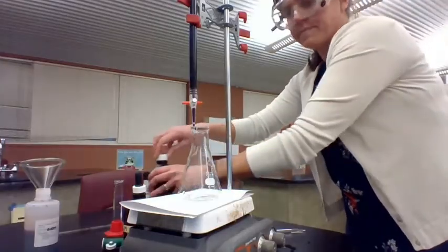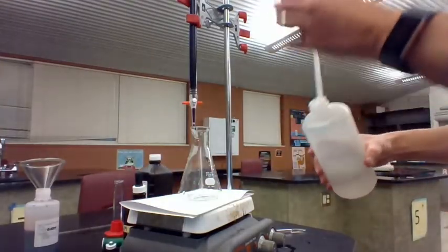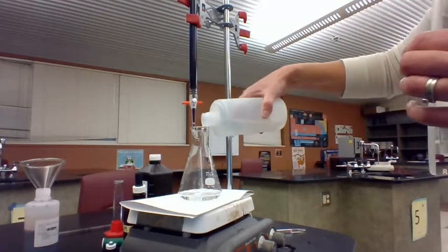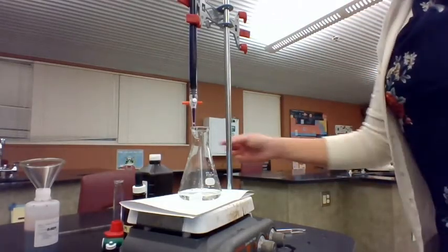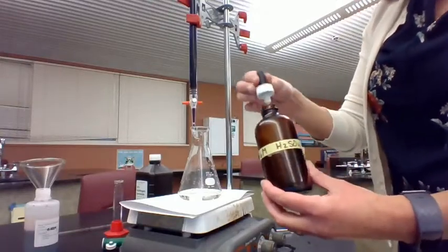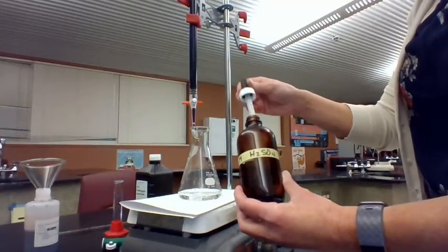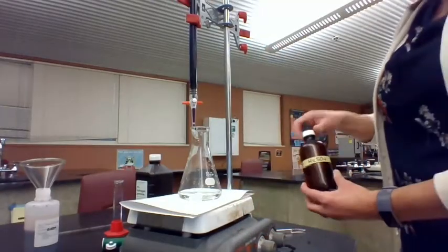And then I'm going to add a little bit of water to this. The water isn't really serving a purpose in the reaction so much — it's just making it easier to see what's going on. And then I'm going to add some sulfuric acid, concentrated sulfuric acid. This reactant is going to be in excess, so I don't need to measure precisely how much I am using.